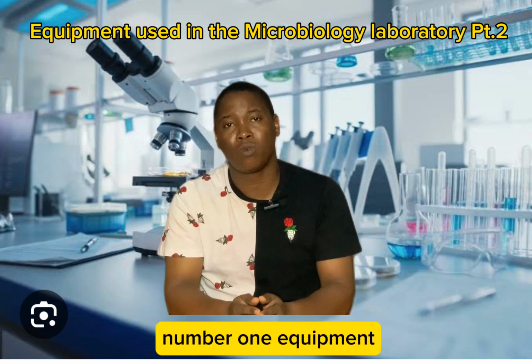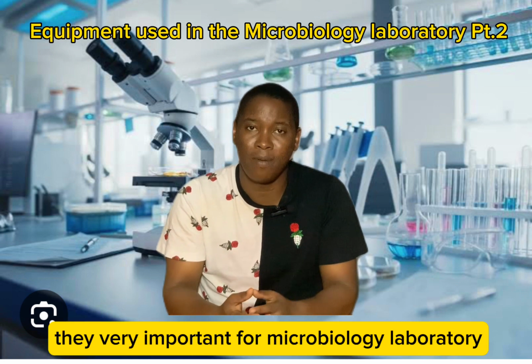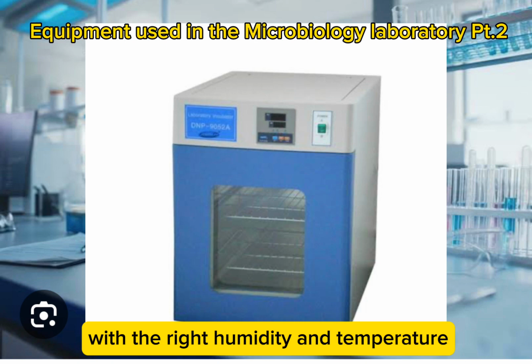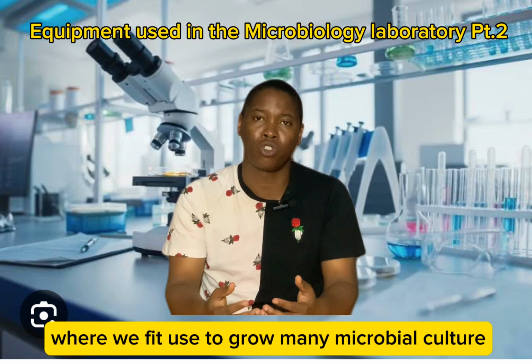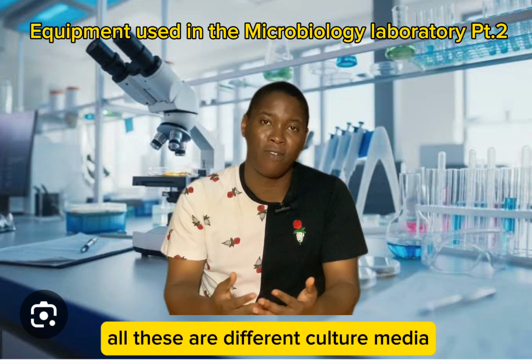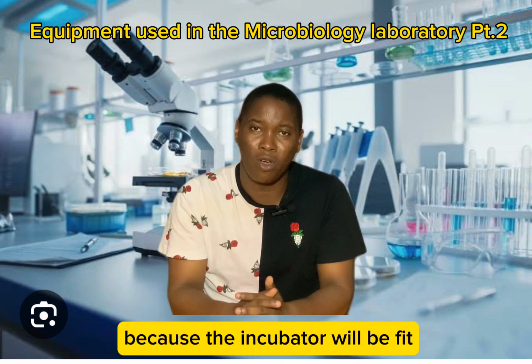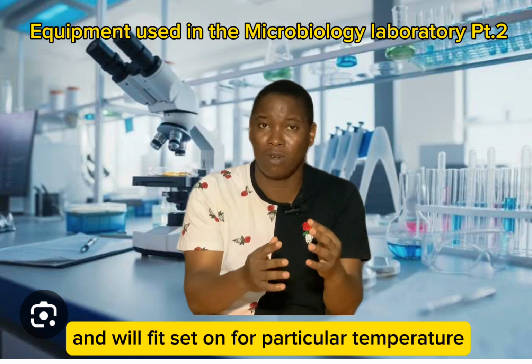The number 1 equipment wey we go discuss na equipment wey we dey call incubator. Incubator dey very important for microbiology laboratory, and the incubator e dey help create environment with the right humidity and temperature wey we fit use to grow many microbial culture. So many times when we put our microorganisms, put them on top all these are different culture media. If we do that one finish, we will come carry that culture media, wrap am well, come put am inside this incubator, because the incubator will dey fit na like box, and we fit set am for particular temperature.